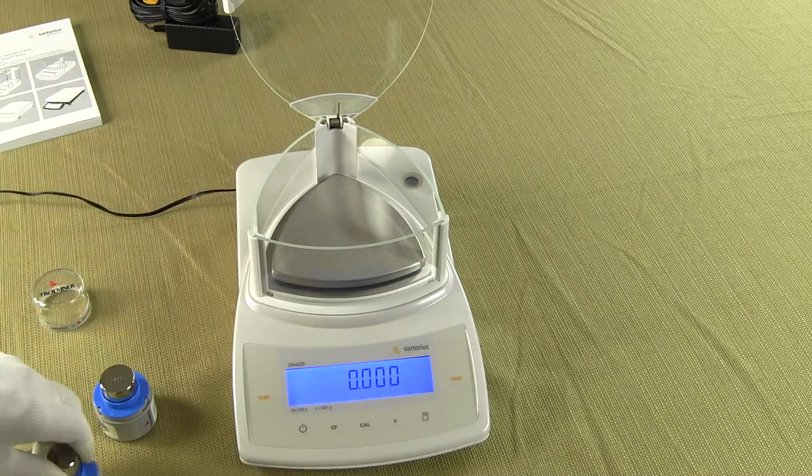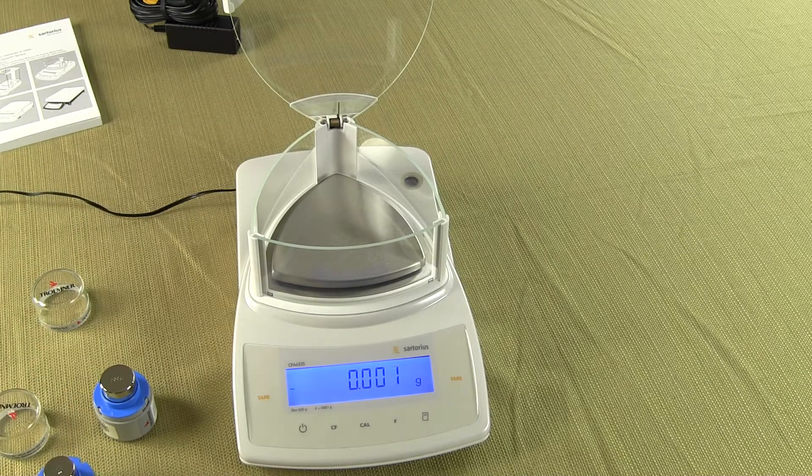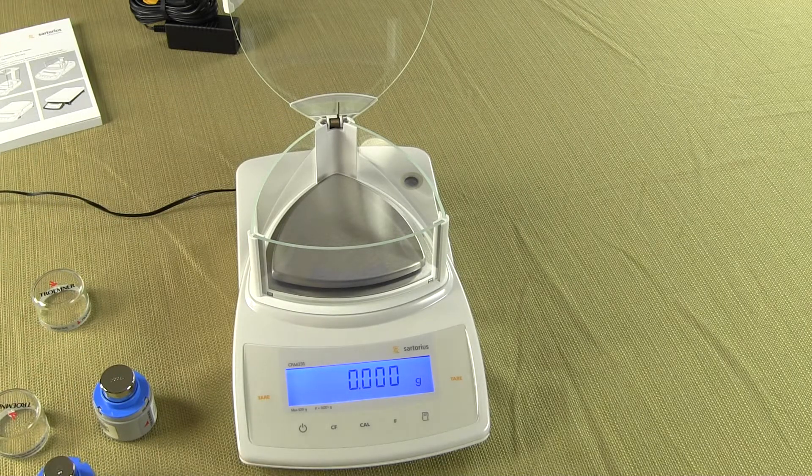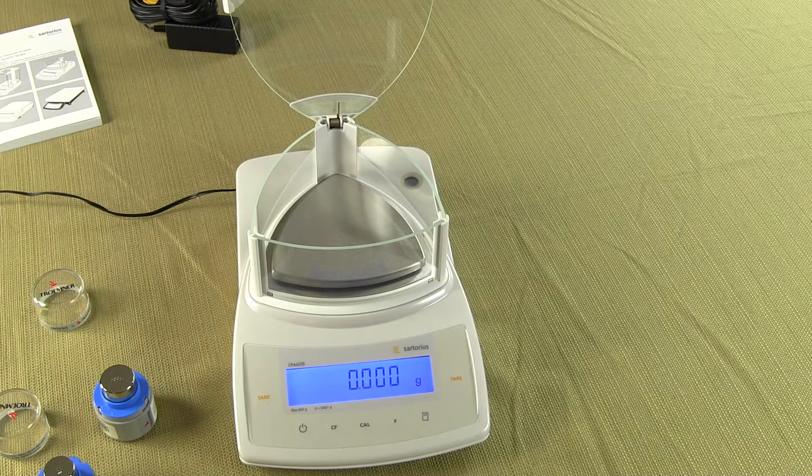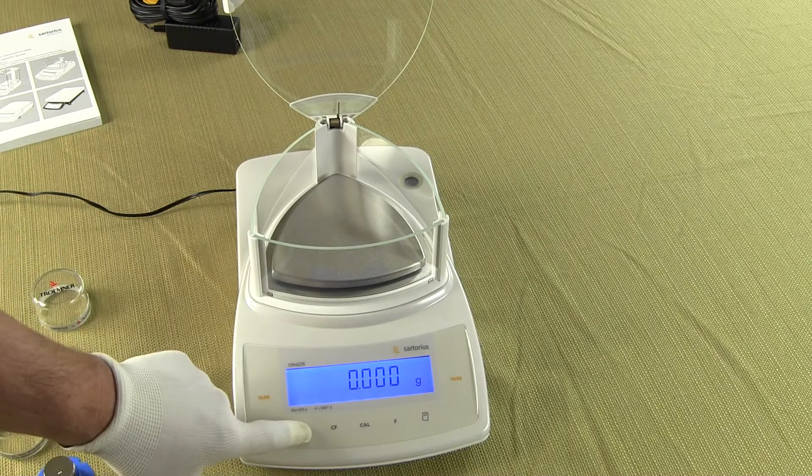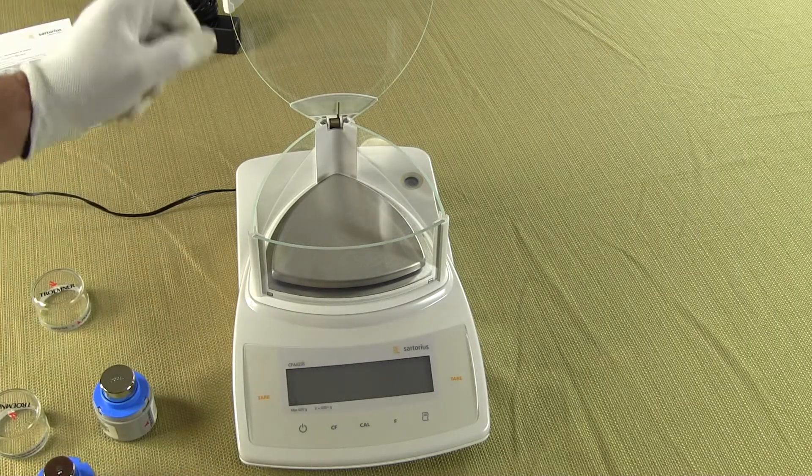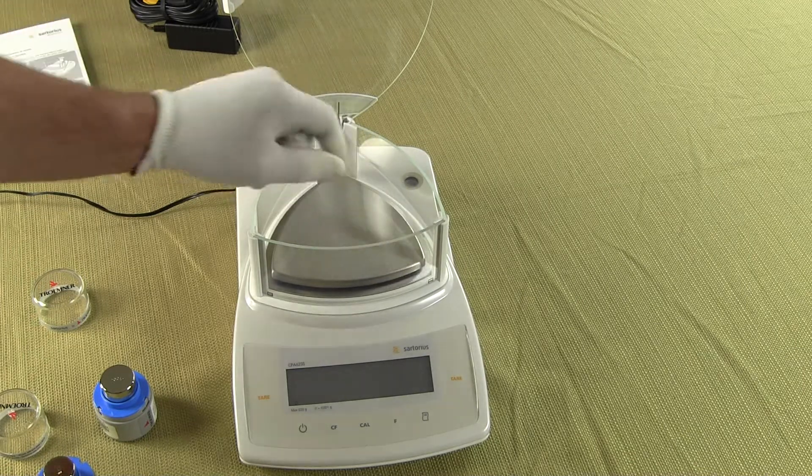So the balance is extremely simple. You know our motto is keep it simple stupid. Sartorius has done it. This is a great balance. I want to show you one more feature that you could outfit this balance with.